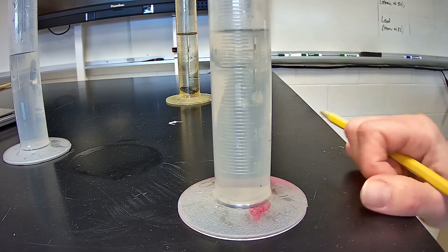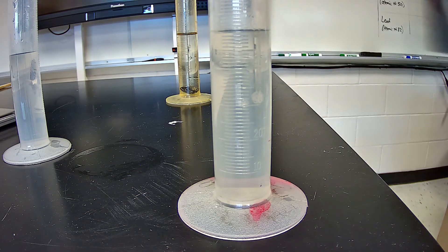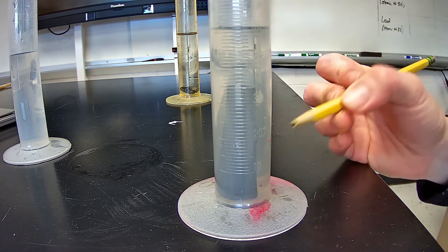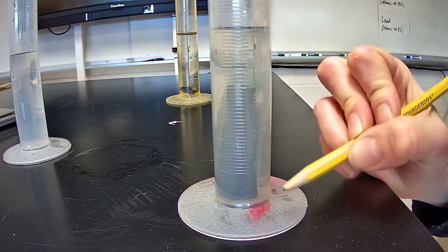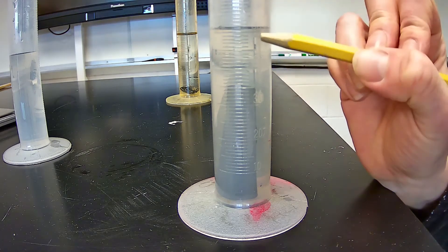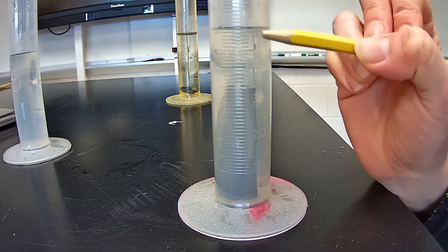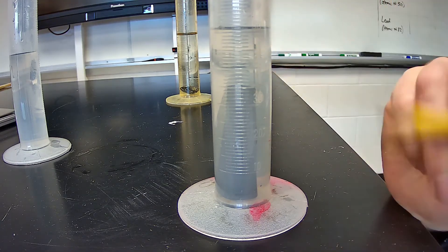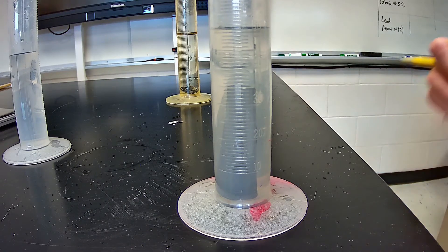Here again we have 50 milliliters, and I'm going to put this piece of tin in the water. Since the tin and the water can't be in the same place at the same time, the water gets pushed up. This long line is 50, and the next is 55, so the reading is definitely less than 55. Read from the bottom of the meniscus — you should be able to see it on the screen.